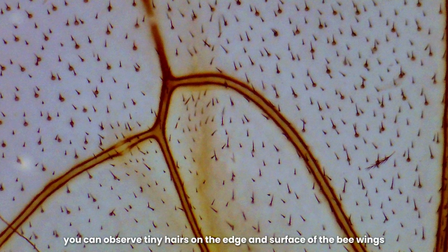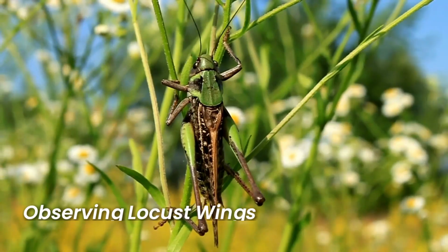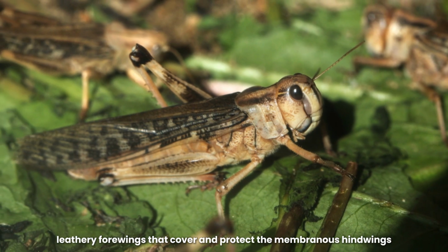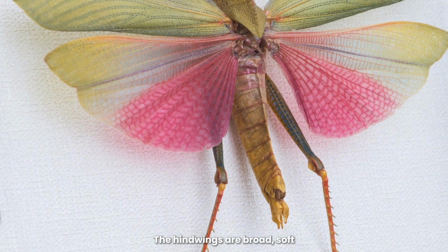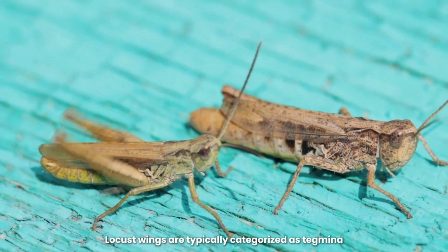When magnified, you can observe tiny hairs on the edge and surface of the bee wings, which help bees sense their surroundings. Observing locust wings. Locusts have two pairs of wings, the narrow, leathery forewings that cover and protect the membranous hindwings. The hindwings are broad, soft, and membranous and unfold during flight. Locust wings are typically categorized as tegmina.